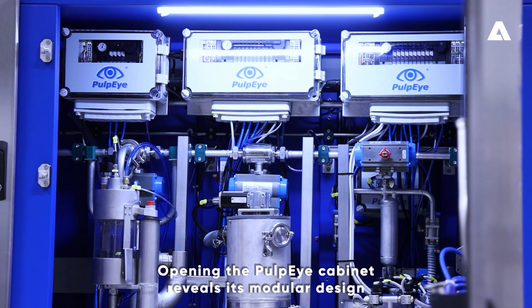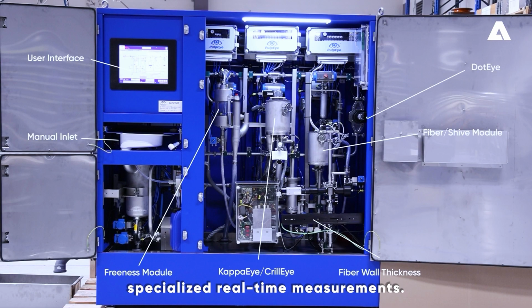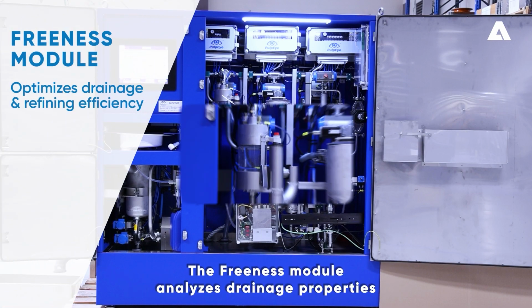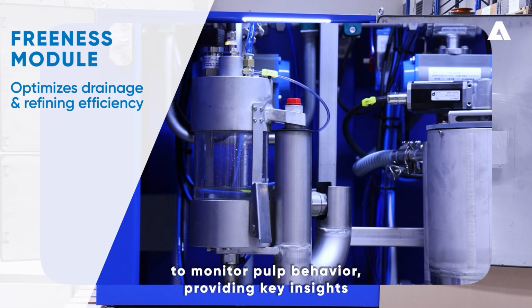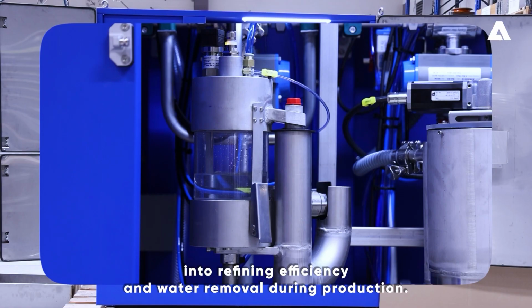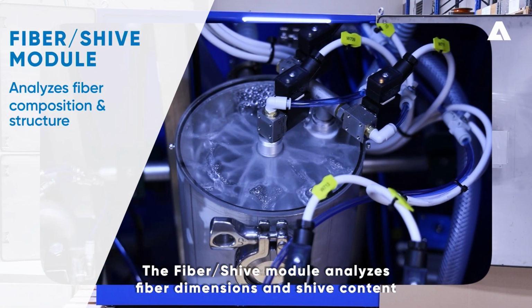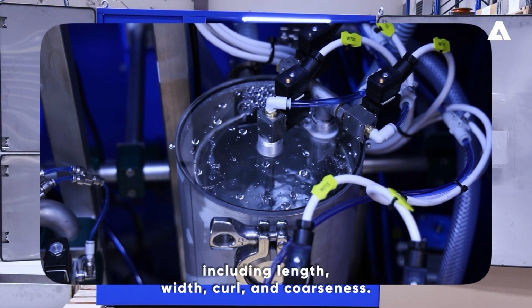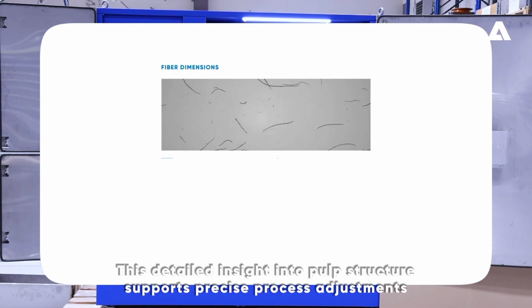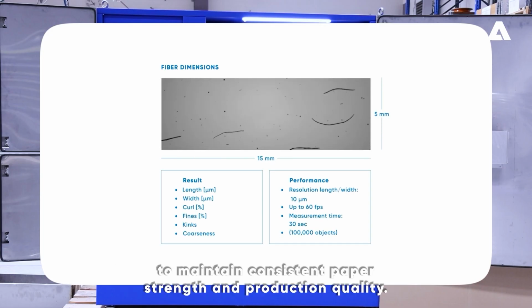Opening the PulpEye cabinet reveals its modular design, where each unit performs specialized real-time measurements. The Freeness module analyzes drainage properties to monitor pulp behavior, providing key insights into refining efficiency and water removal during production. The Fiber Shive module analyzes fiber dimensions and Shive content, including length, width, curl, and coarseness. This detailed insight into pulp structure supports precise process adjustments to maintain consistent paper strength and production quality.